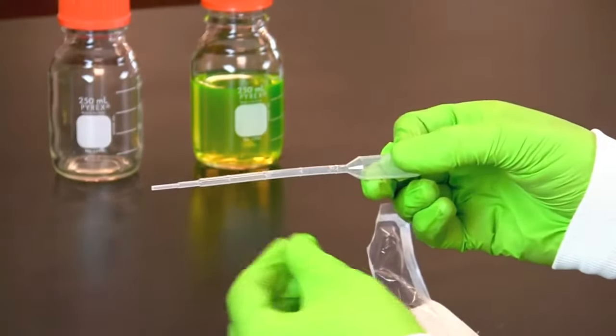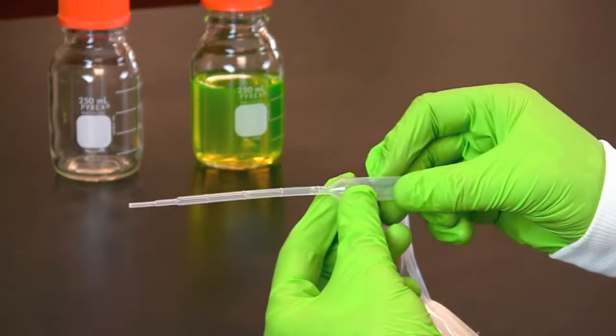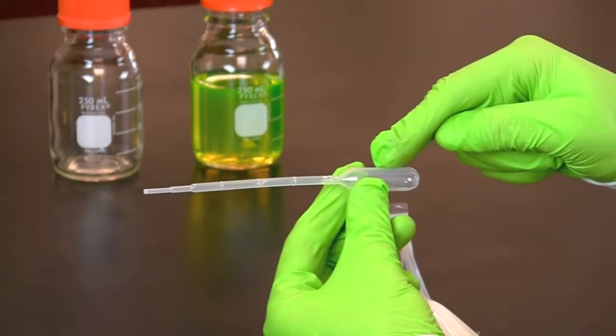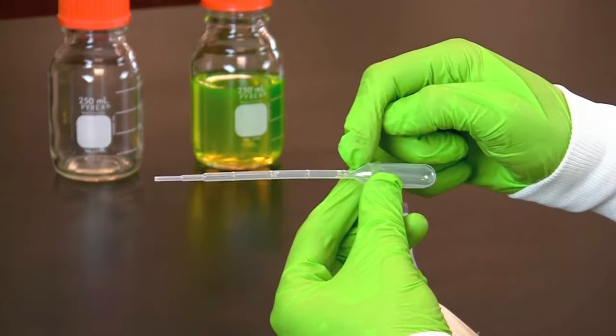This is a 1 milliliter graduated Disposable Plastic Transfer Pipette. The pipette has a bulb that is connected to a shaft.